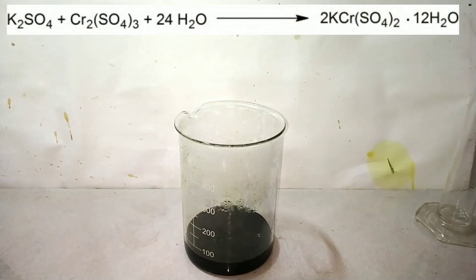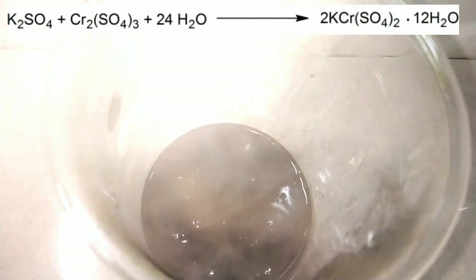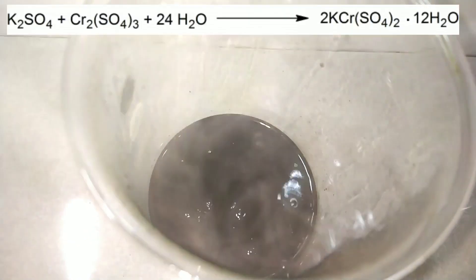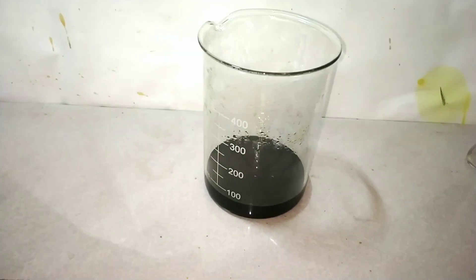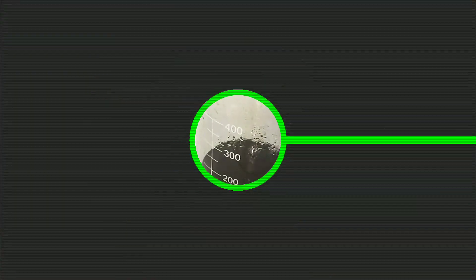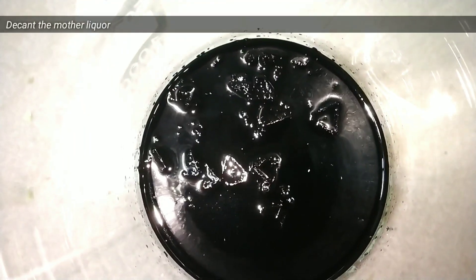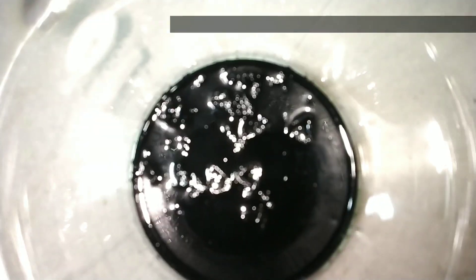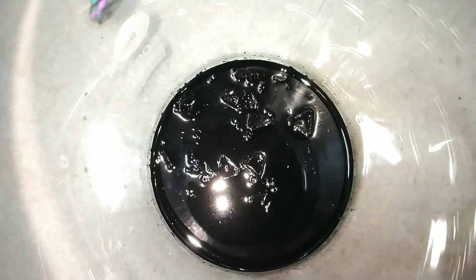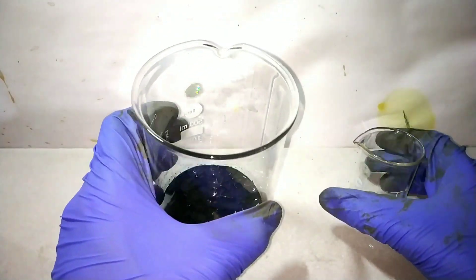Potassium sulfate and chromium sulfate will now combine to form the chrome alum. We will keep this beaker undisturbed for a week. By about 5 days, we can see that crystals have started to form. We will keep this undisturbed for a couple more days, and after about 7–8 days, most of the crystallization is complete.